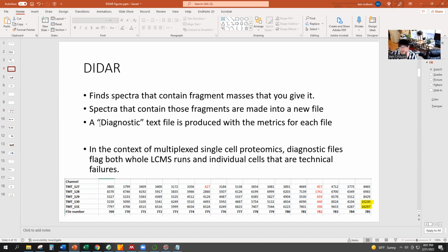And then it also generates a diagnostic text file that provides metrics for each file. And that's what we're really going to use for QC here. In the context of SCoPE-MS or multiplex single cell proteomics, I'm using these diagnostic files, laying them out, and you can see here's an example across. These are files that we've acquired on the timsTOF, and this is the permanent suffix that the instrument assigns to files. And we see here in file 775, something went wrong with cell number 120. It was labeled 127 in this run.